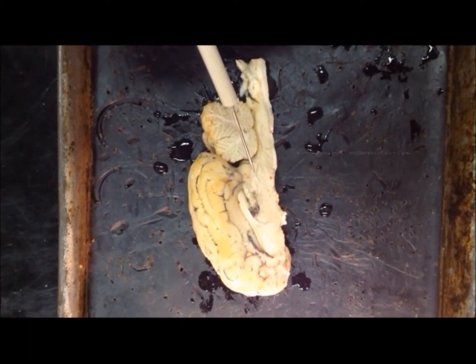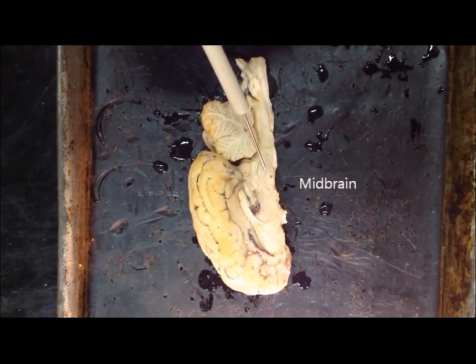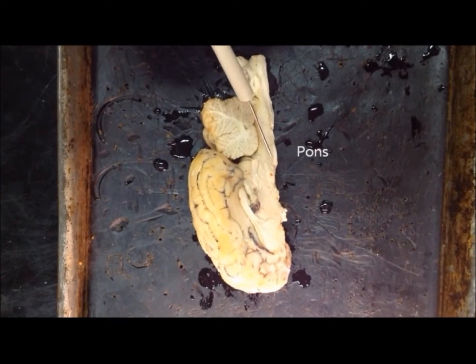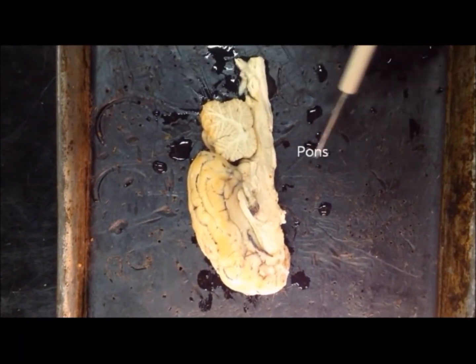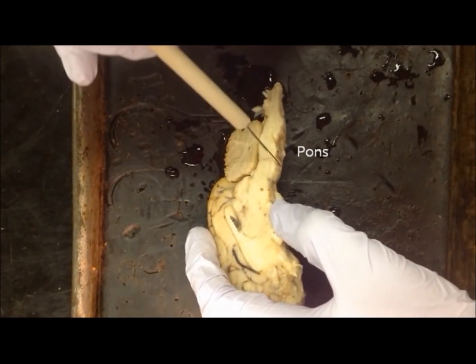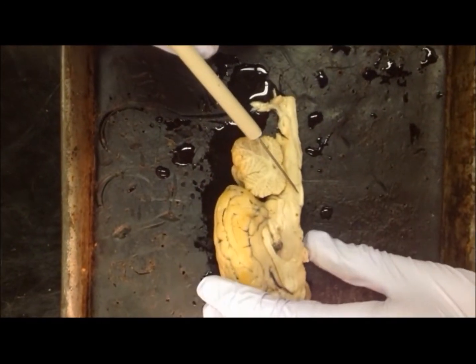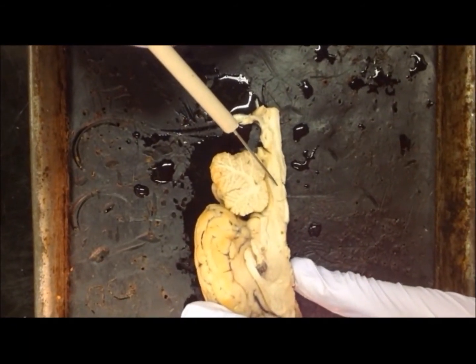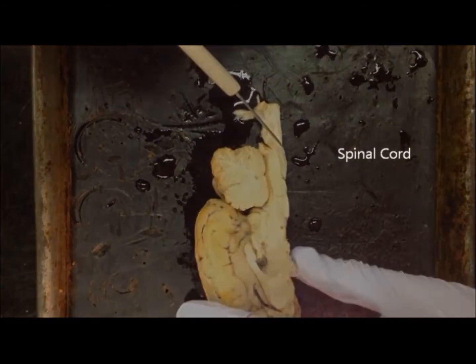Continuing to move ventrally, we can see the midbrain. From the midbrain and moving posterior is the pons. The pons can be indicated by a slight bump. From the pons and moving posterior is the medulla, and from the medulla and posterior is the spinal cord.